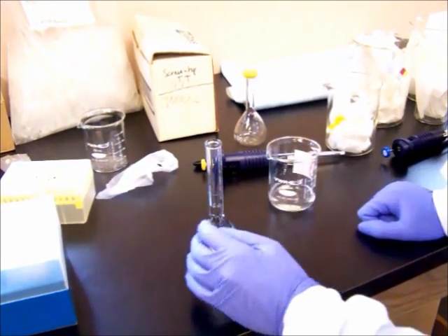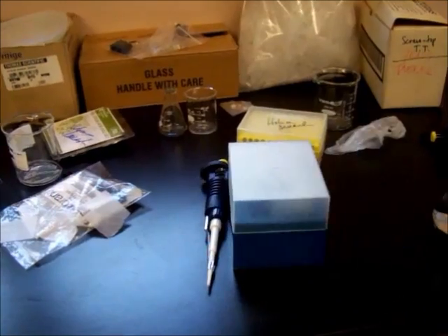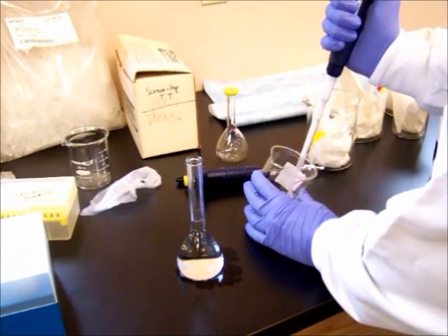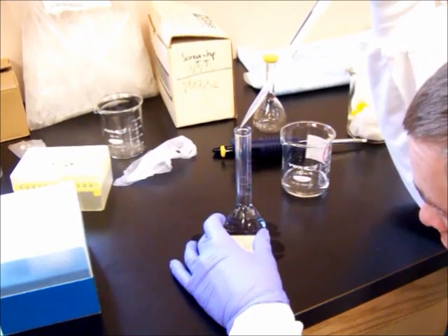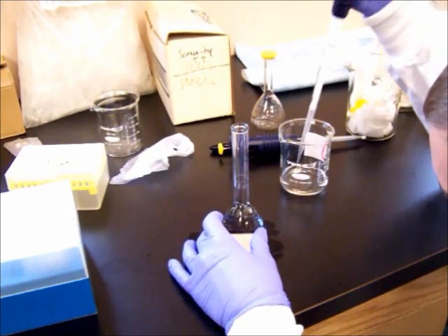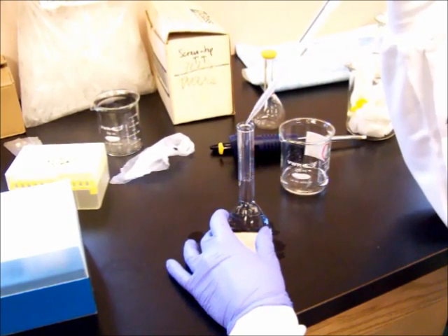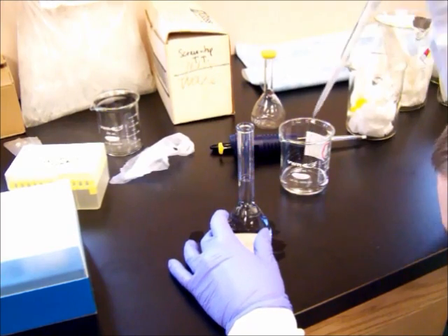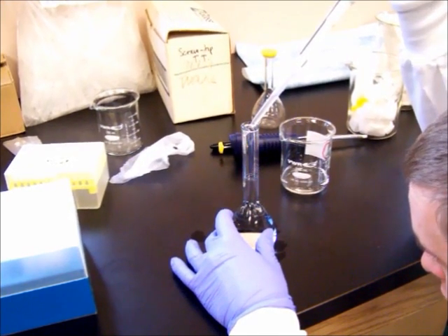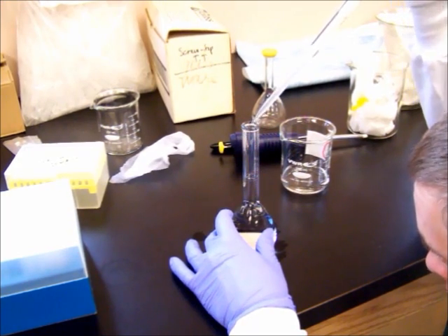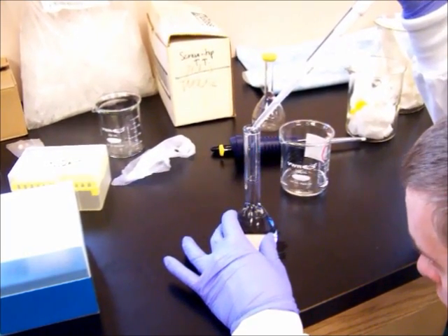I'd like to take it to about a few centimeters, about a centimeter below the fill line. At this point, take your pipetter. And get your face down in there and fill. Make sure your face is parallel. Fill line and very gently pull it in so that the bottom of the meniscus is touching the mark. I'm going to overfill. So right now, about right. Get out more. Good.